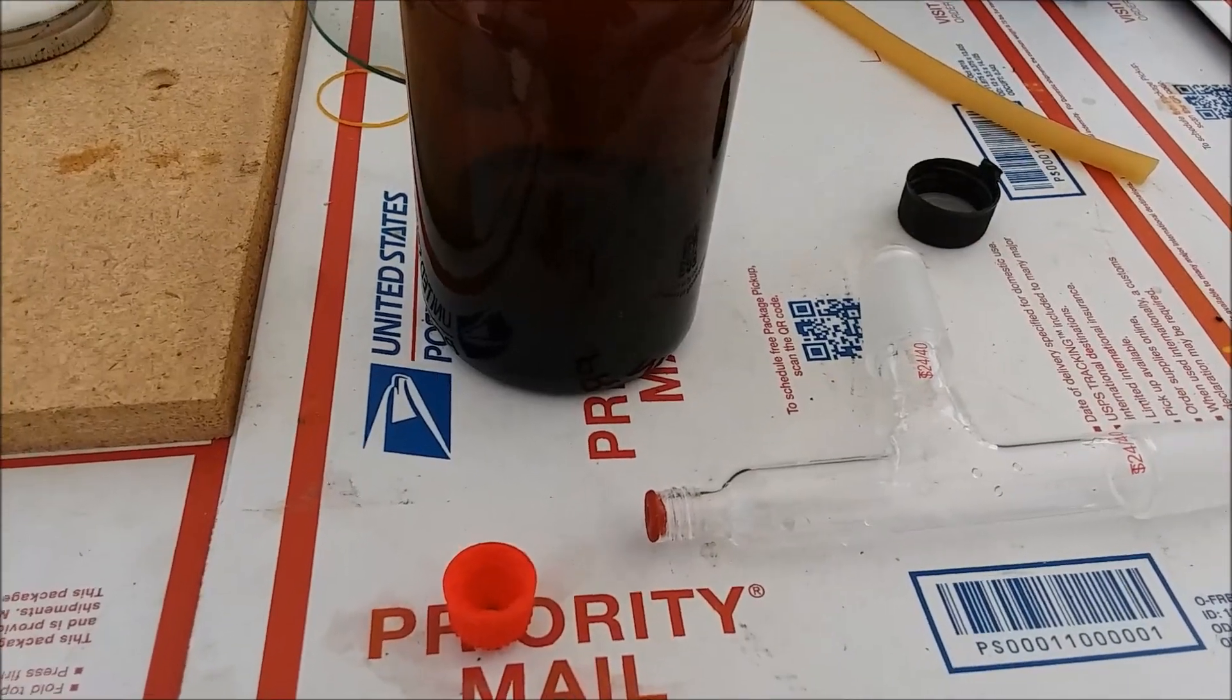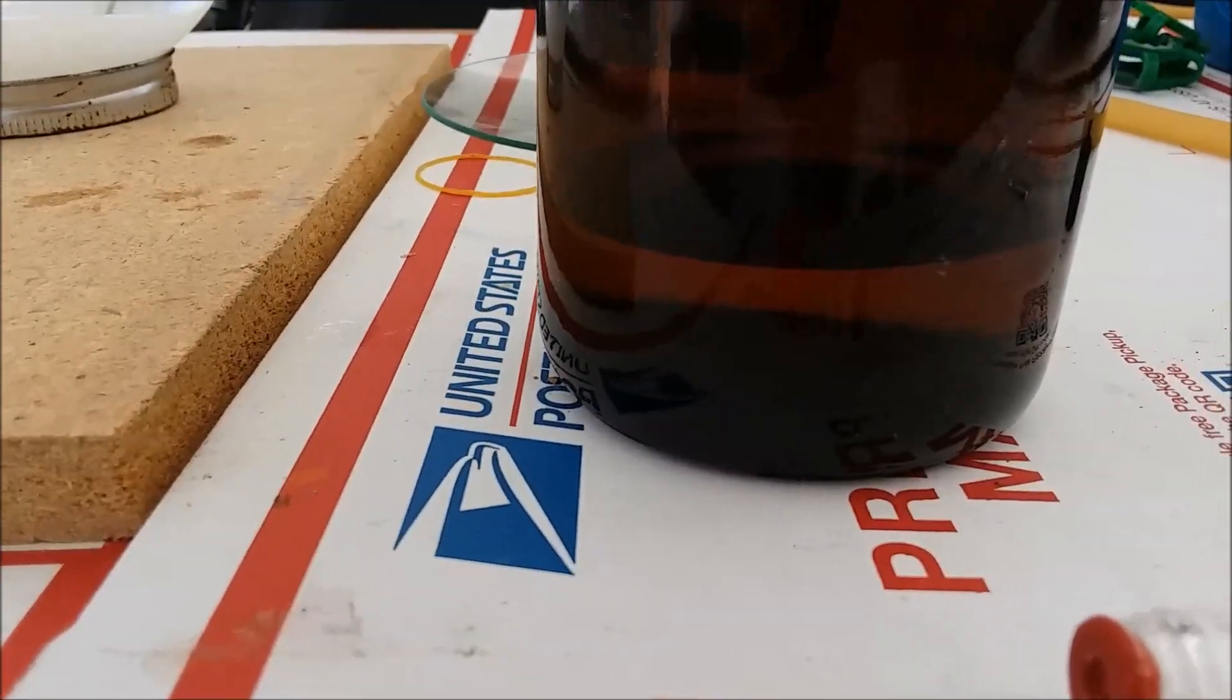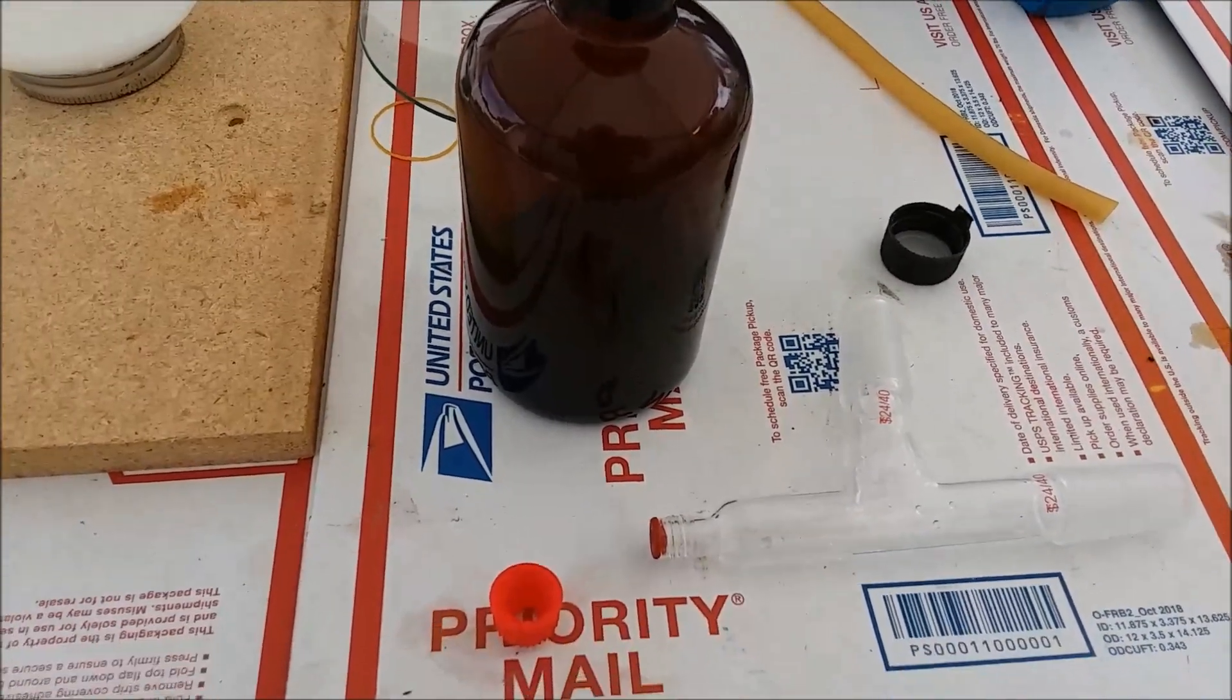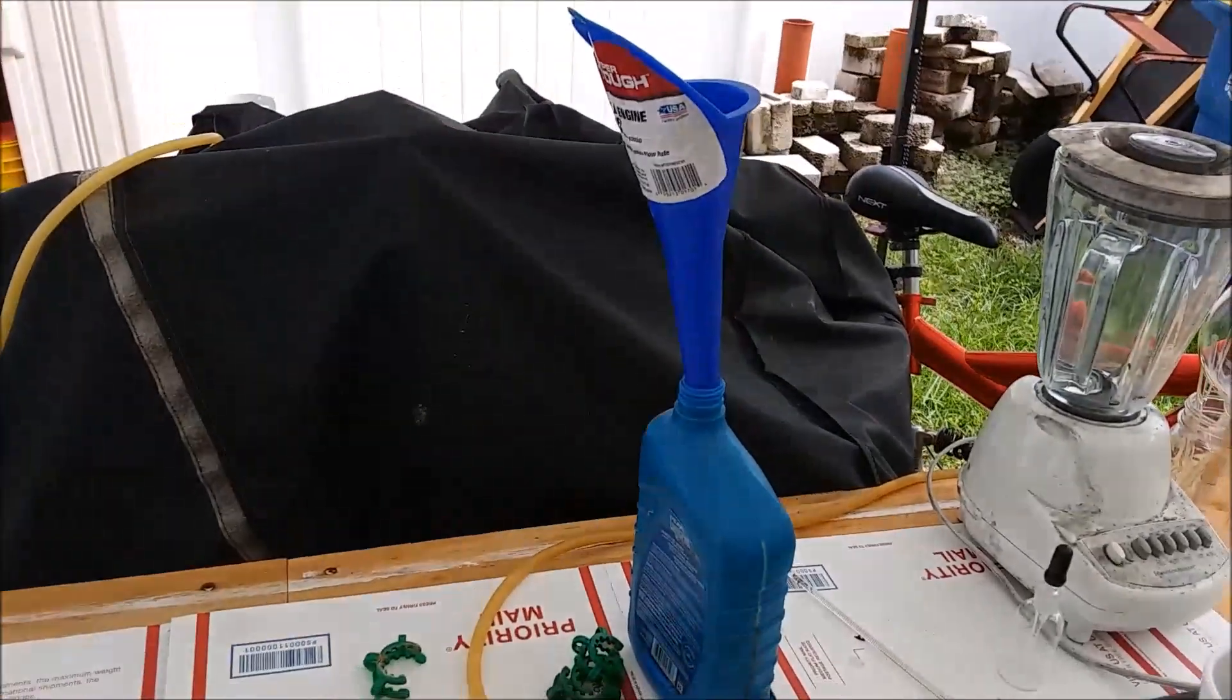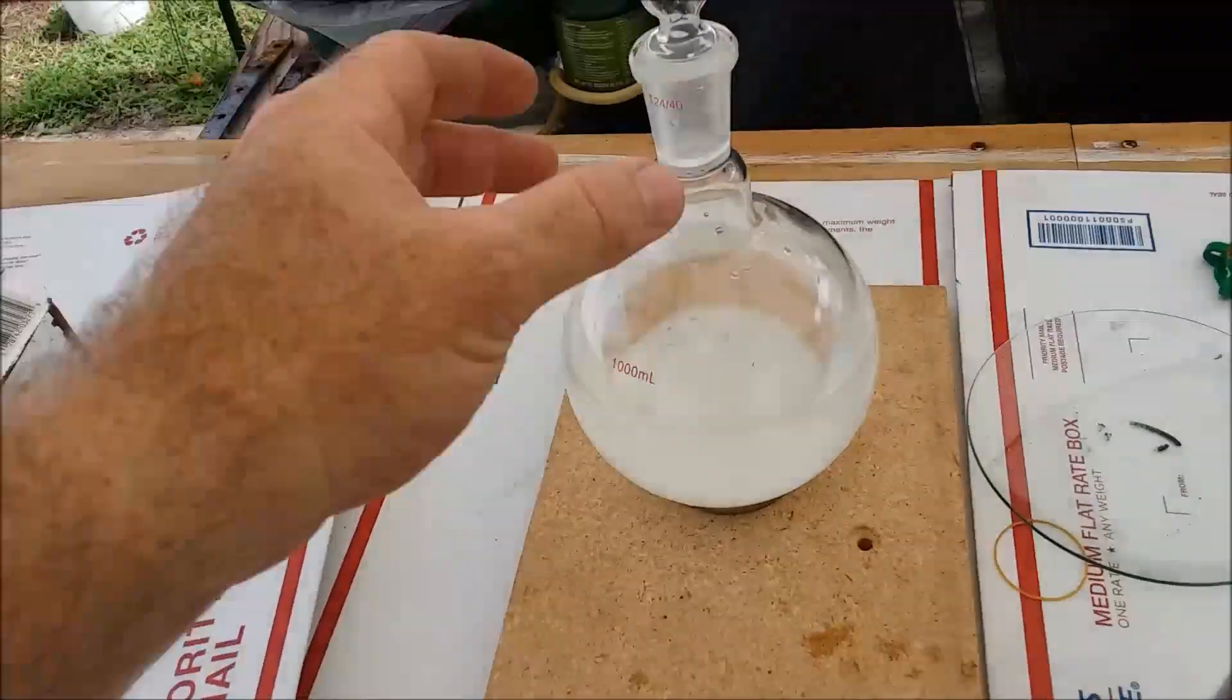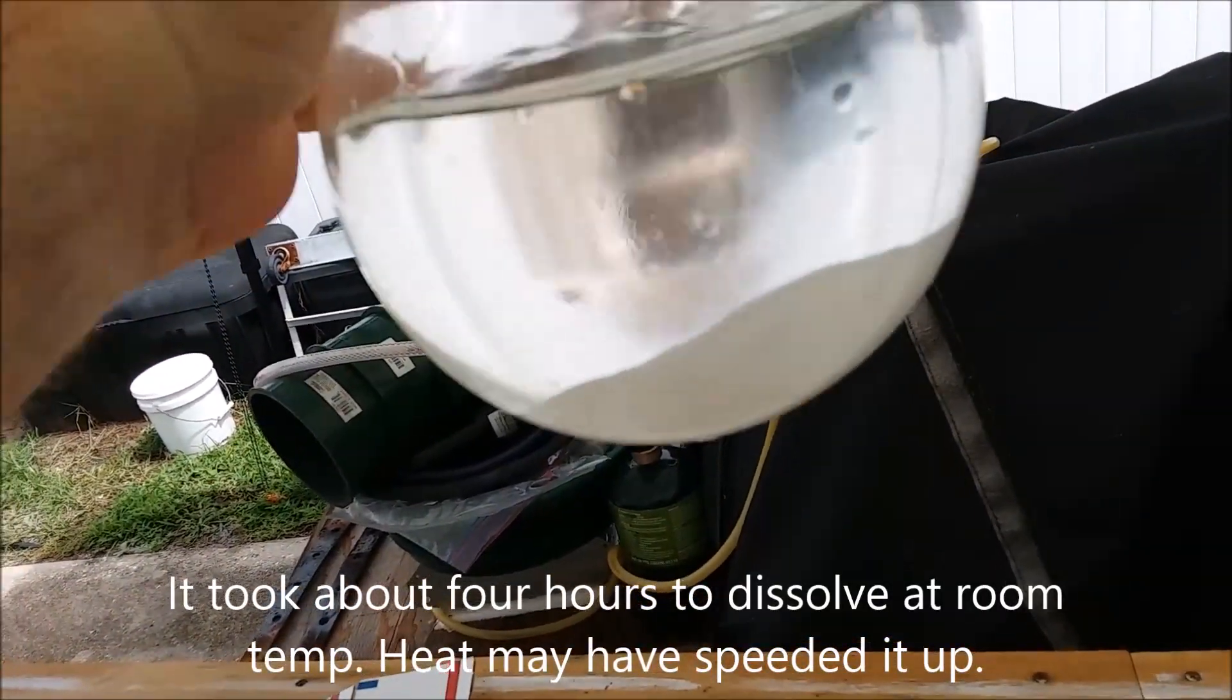I will be using this for gold refining. Finally I have nitric acid that doesn't cost me an arm and a leg. The nitric acid synthesis went relatively painlessly. There's roughly 132 milliliters of the dilute acid in my brown acid bottle. As with most things, the cleanup is the hard part. Getting rid of the motor oil I was using for the oil bath, I'll just dump it back in the bottle, I'll reuse it in the future. Dissolving the big slug of sodium bisulfate that's in here, that's going to take a while.